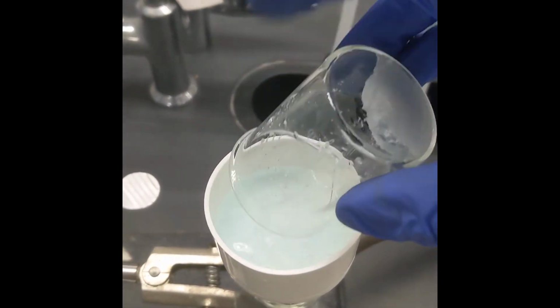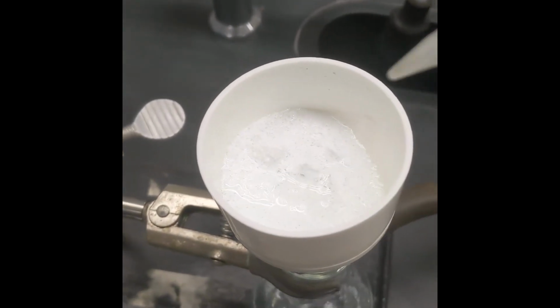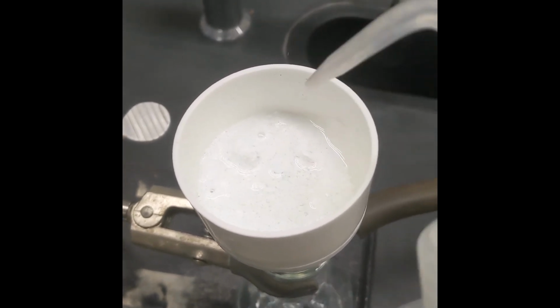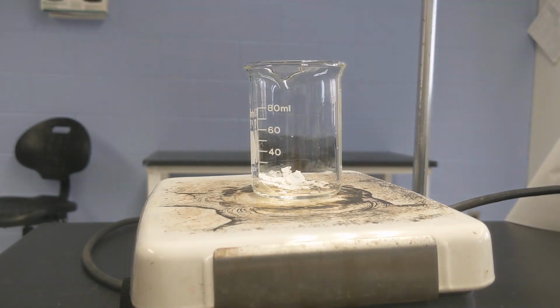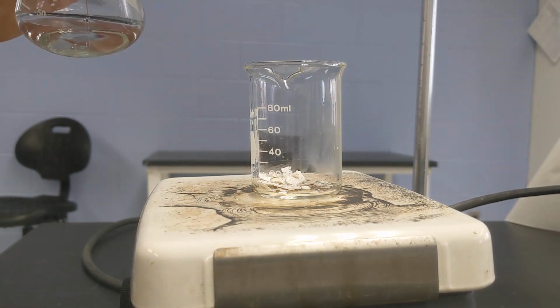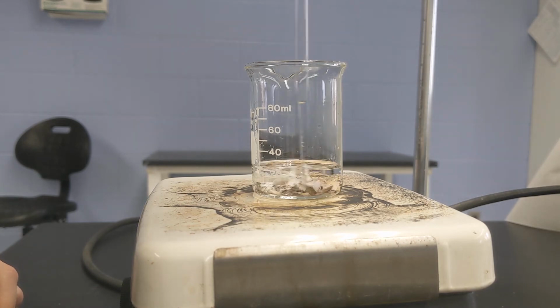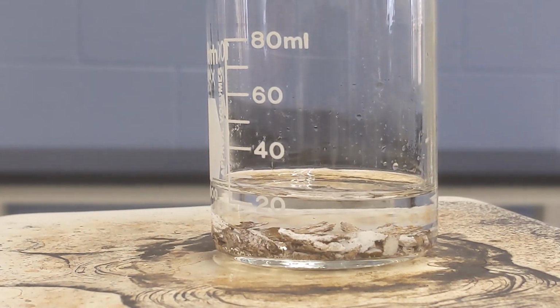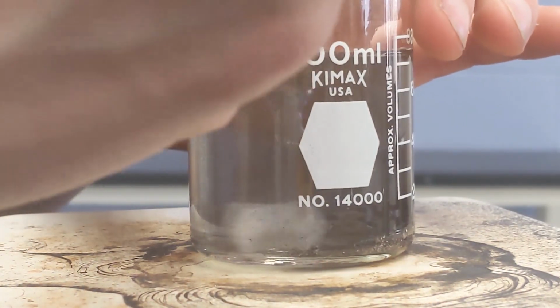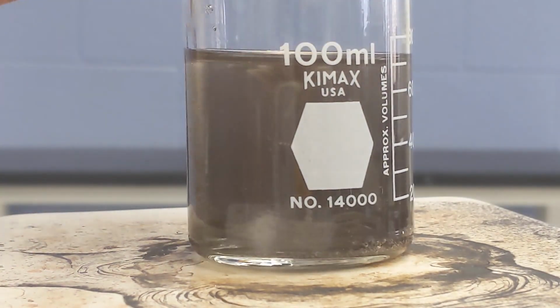This method has a lot of advantages. Mainly, because the chloride is so insoluble, I can just wash as much as I want with water and remove any impurities. The next step, and this would have been the end of it, was to convert the silver chloride back into native silver metal. There were many possible reactions, but what I first chose to do was to add sodium hydroxide to basify the liquid, and we can see that the liquid is turning brown. And what's actually happening is that the silver chloride is becoming silver oxide, which is brown, and it's being broken apart and suspended in the solution.